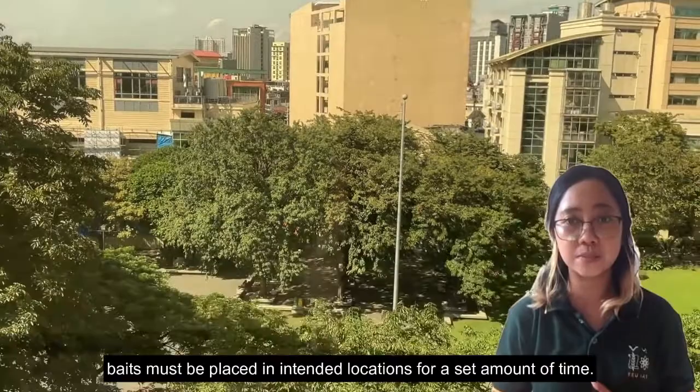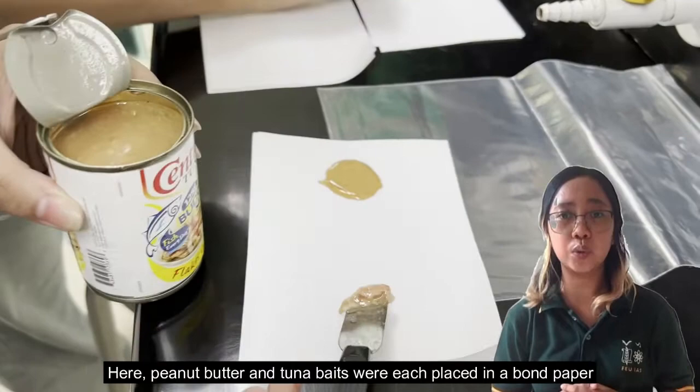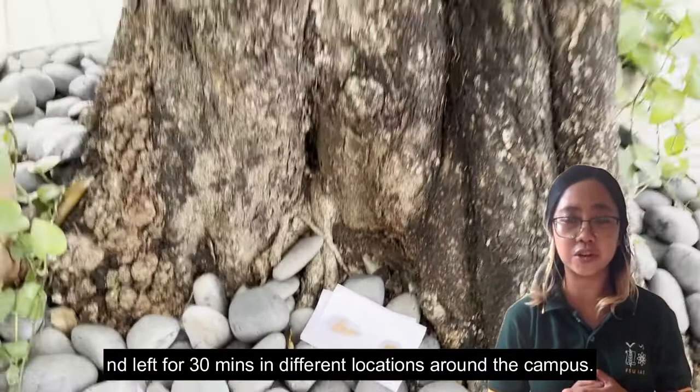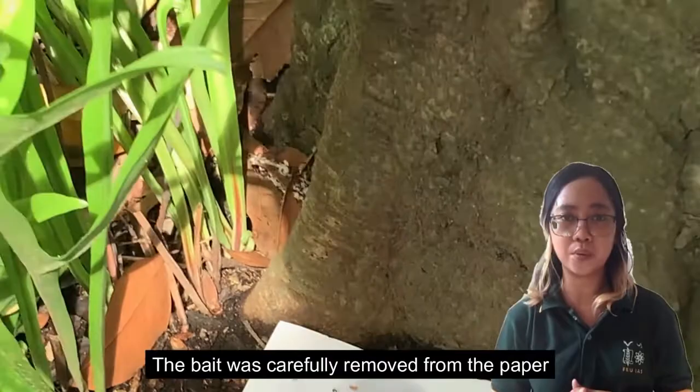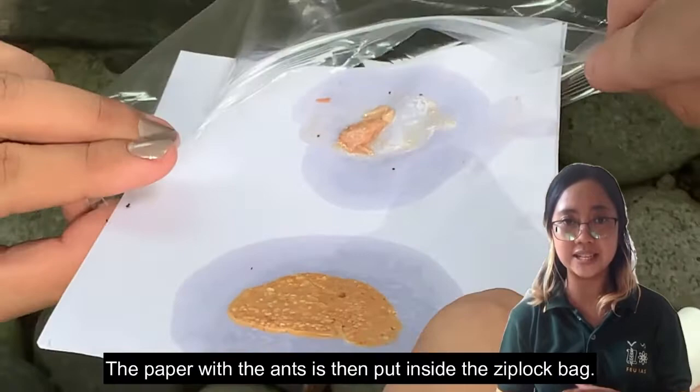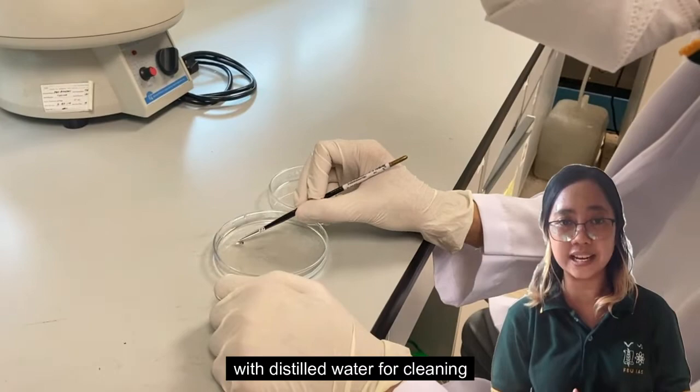For passive collection, baits must be placed in the intended location for a set amount of time. Here, peanut butter and tuna baits were each placed on bond paper and left for 30 minutes in different locations around the campus. After the allotted time, the collector sprayed alcohol onto the bait to immobilize the specimens. The bait was carefully removed from the paper without removing any specimens collected, and the paper with the ants was then put inside a Ziploc bag. The ants were submerged in a petri dish with distilled water for cleaning before being placed in alcohol vials.